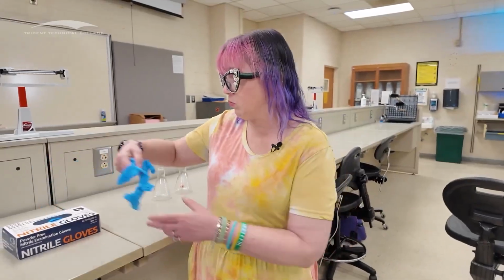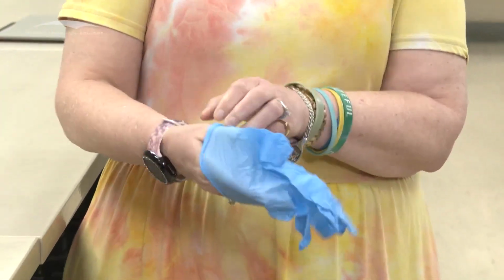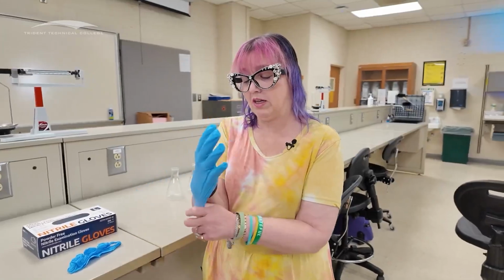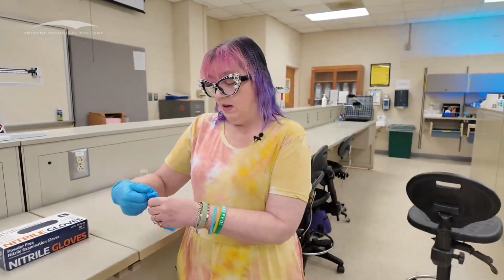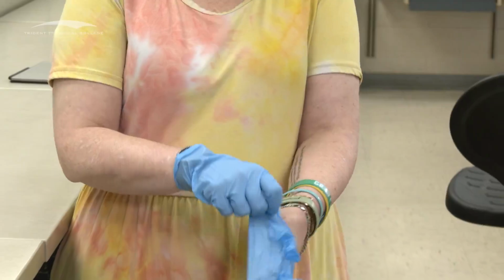We're going to take gloves out of this container. Here's one, here's two. I'm going to set those down. We're going to make sure that we put them on appropriately. So we want to make sure that we get our thumbs into the thumb spots on our gloves. So that's one. I want to get that over my watch because I want to make sure I don't ruin my watch while I'm wearing it. And then have my second one, if I can get this sorted out because they're all shoved in there.